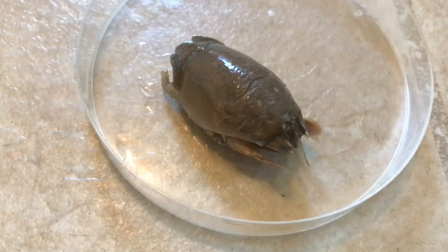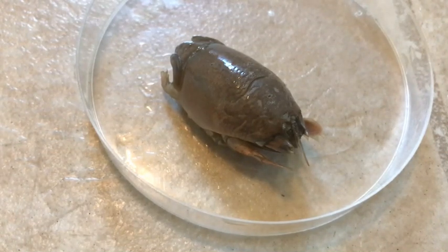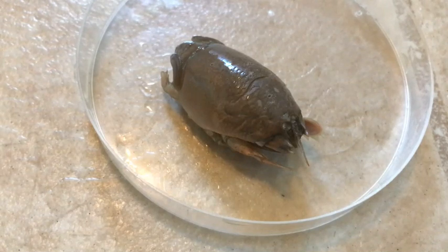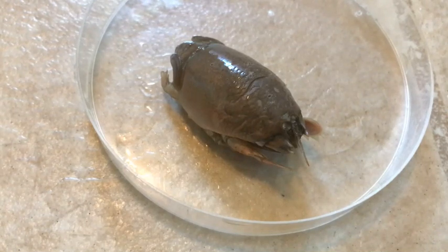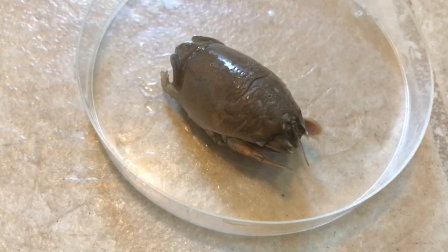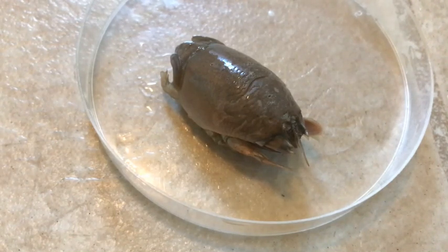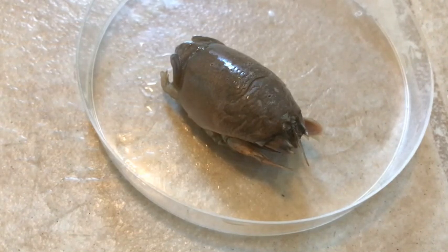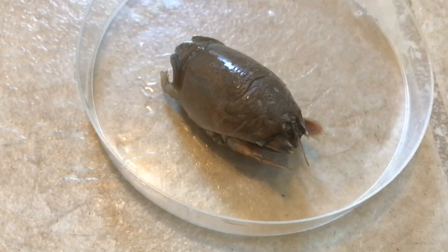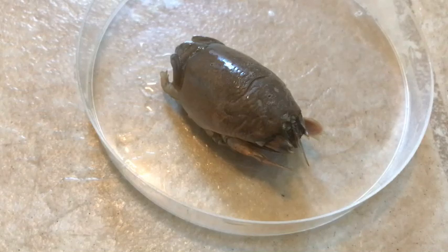Welcome to my kitchen floor! Here we are, about to start our crab dissection. You saw in the previous slideshow the life cycle of these acanthocephalan parasites and how they get into the sand crab. Now I'm going to show you how we conduct these dissections step by step, and let's see if we can find any parasites.